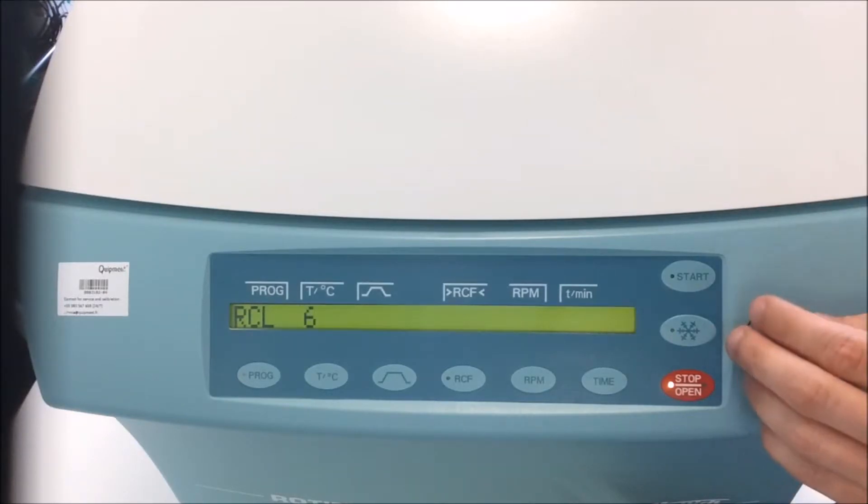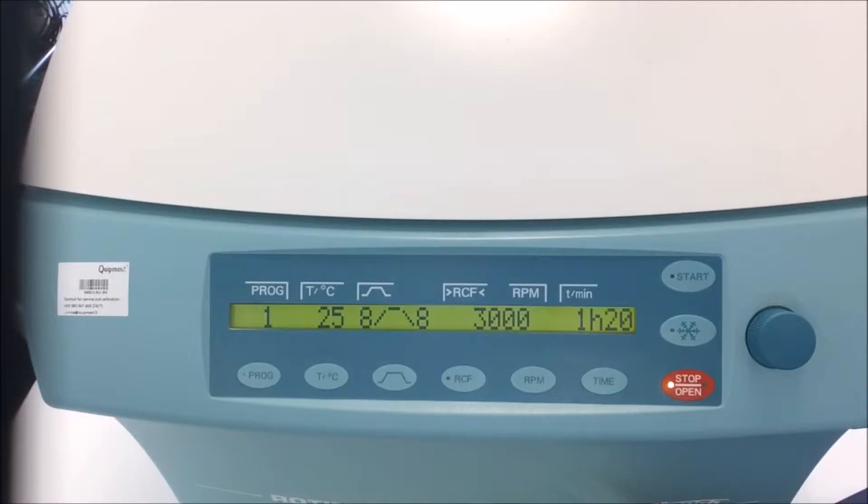I will just charge program number 1. Here it is. As you can see, it's pre-programmed.